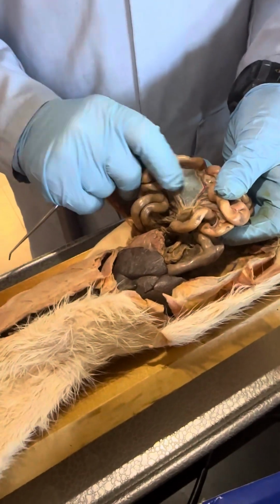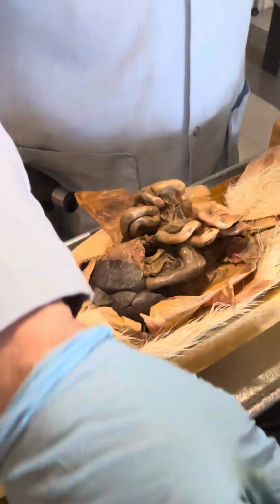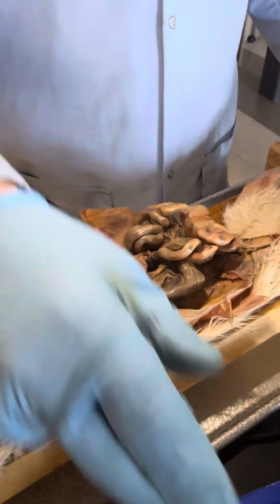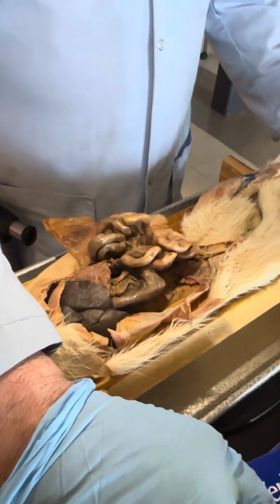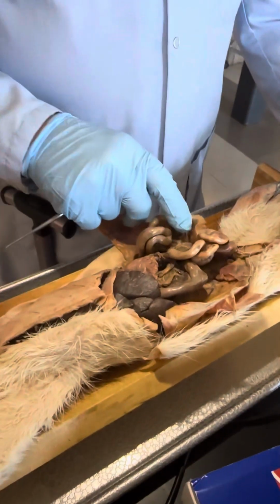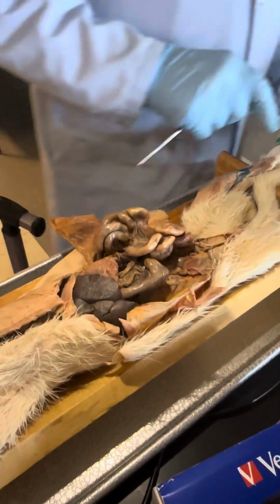That clear stuff right there is the, whoop, what happened? That was weird. No, this is not gas. Well, we'll be back in a second here, I think. There it is. Okay, I'm not really sure why that happened. Oh, my blue fingernails are back.